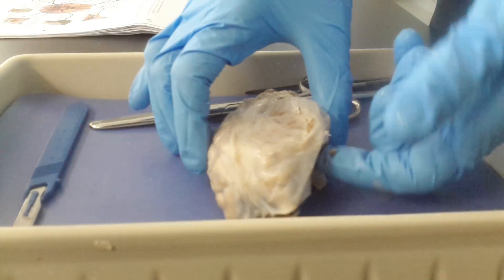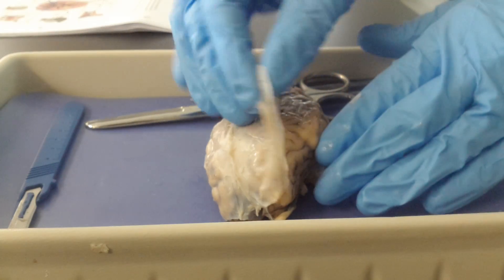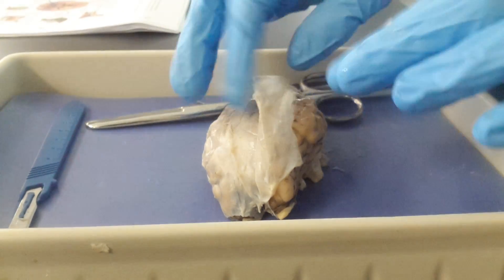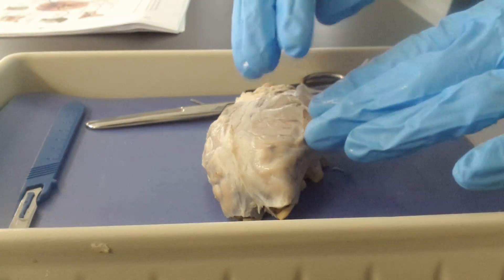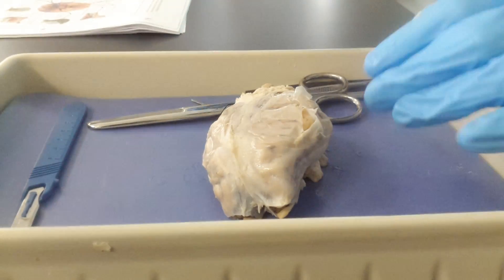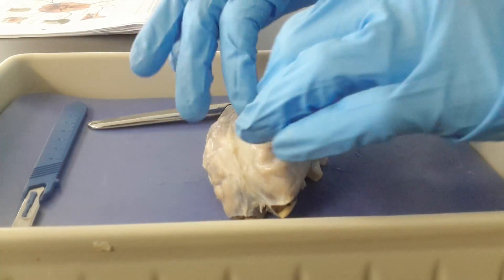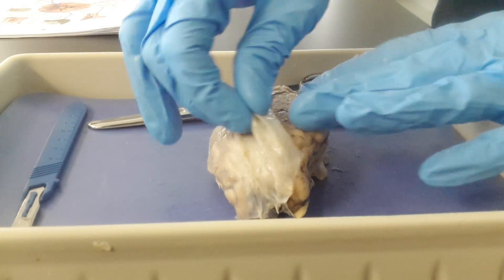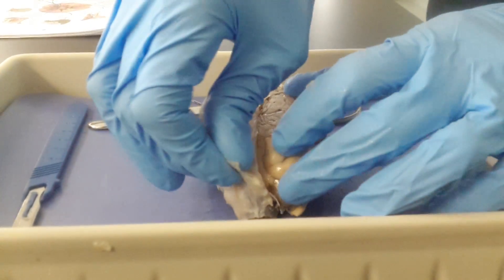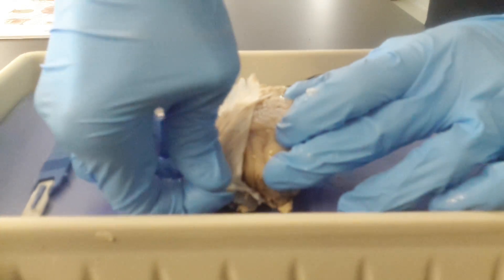I've already cut the dura mater around the outside, and I'm going to go ahead and remove it. As I remove it, let's pay attention to the way that the dura mater folds down into the deep fissures of the brain. Remember that those are called the dural folds, and that those help to stabilize the position of the brain in the skull, kind of like a seatbelt.